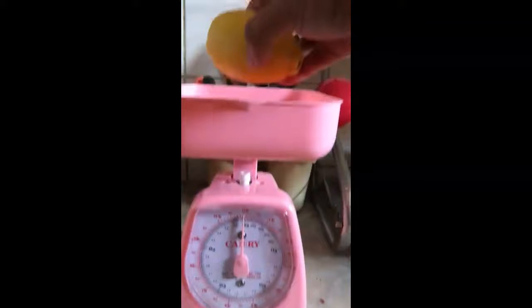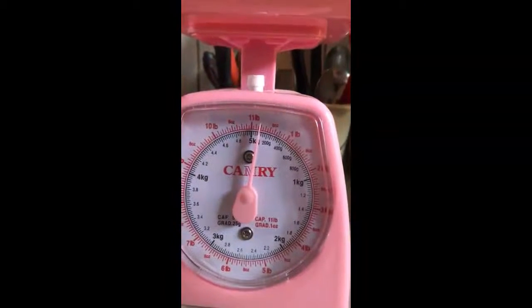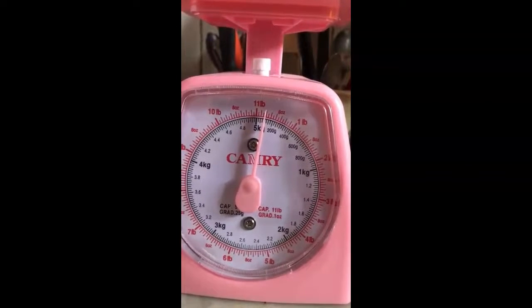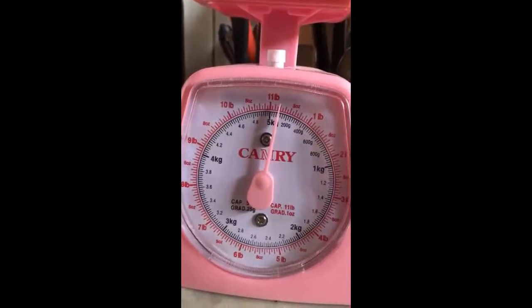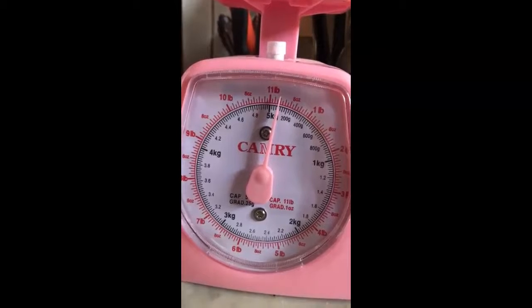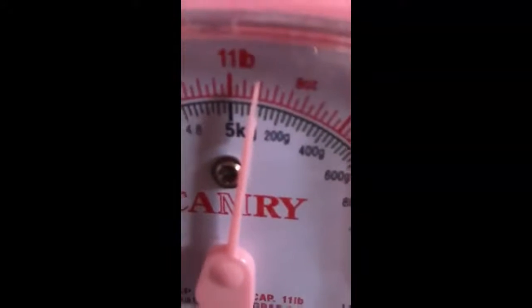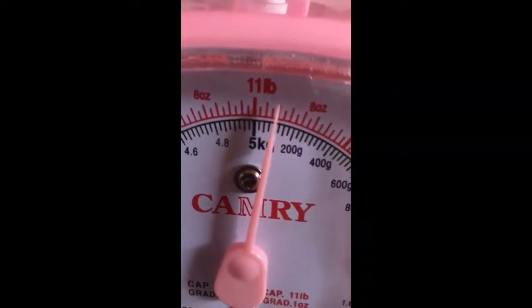Now I am going to measure the mass of the lemon. I place it on the balance. Then now we can see what you can do. You can count the number of divisions. From the 11 you can start, 11, then after that the small divisions 1 2 3 4. Exactly, it is at 4, the fourth division on the red line, right on the top, not at the bottom. So you can see it closer. 1 2 3 4, exactly 4 divisions are there.